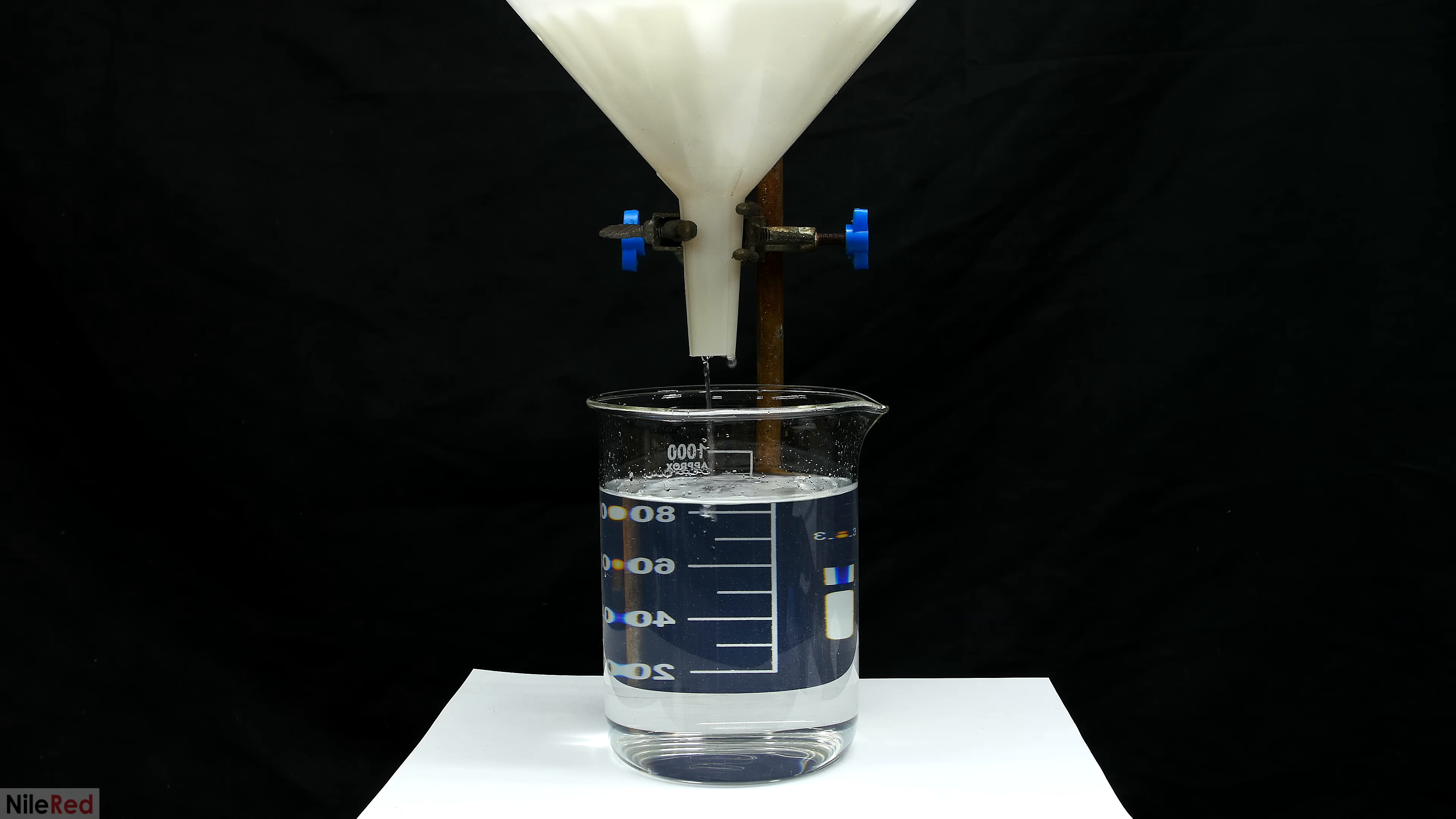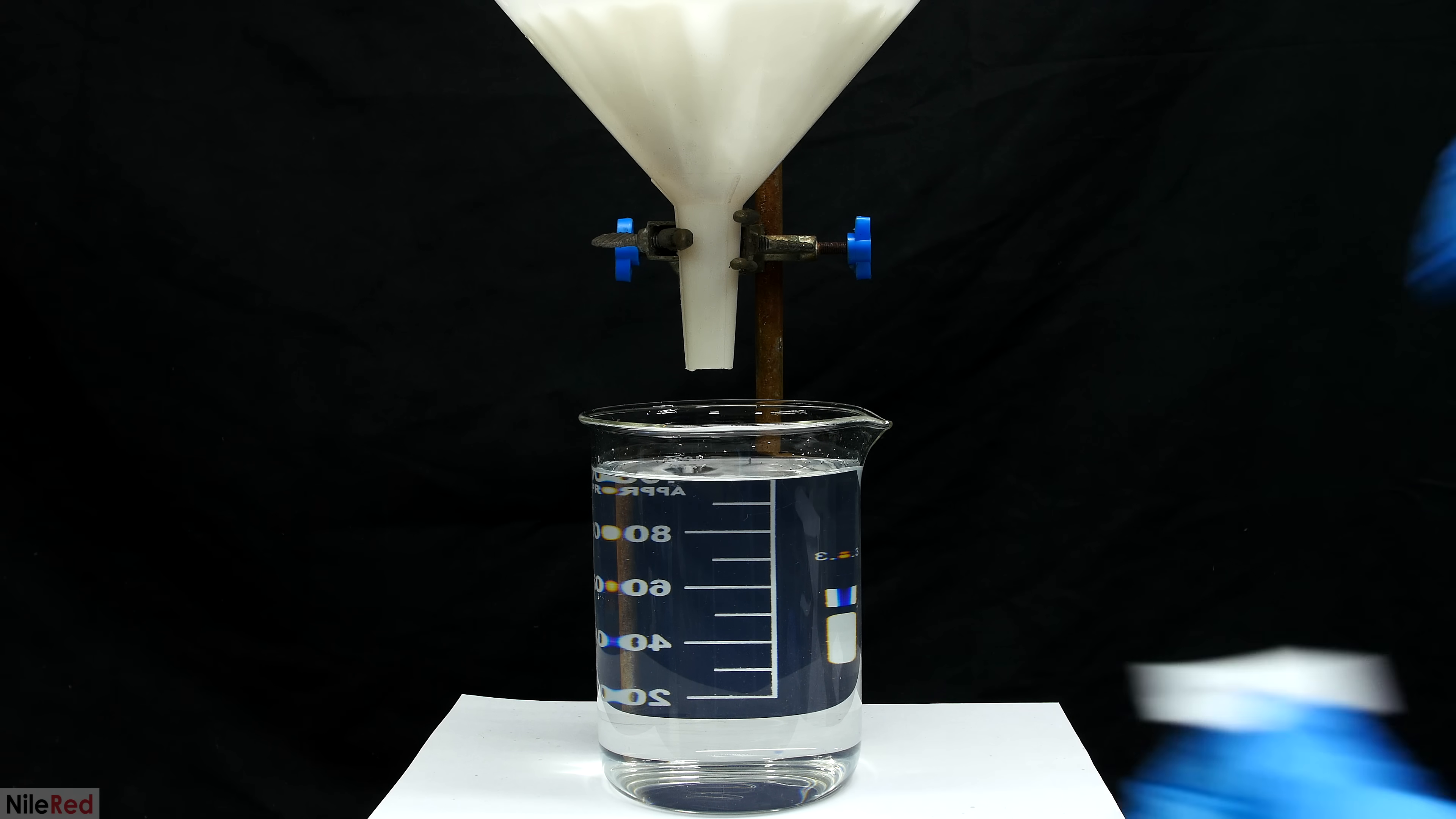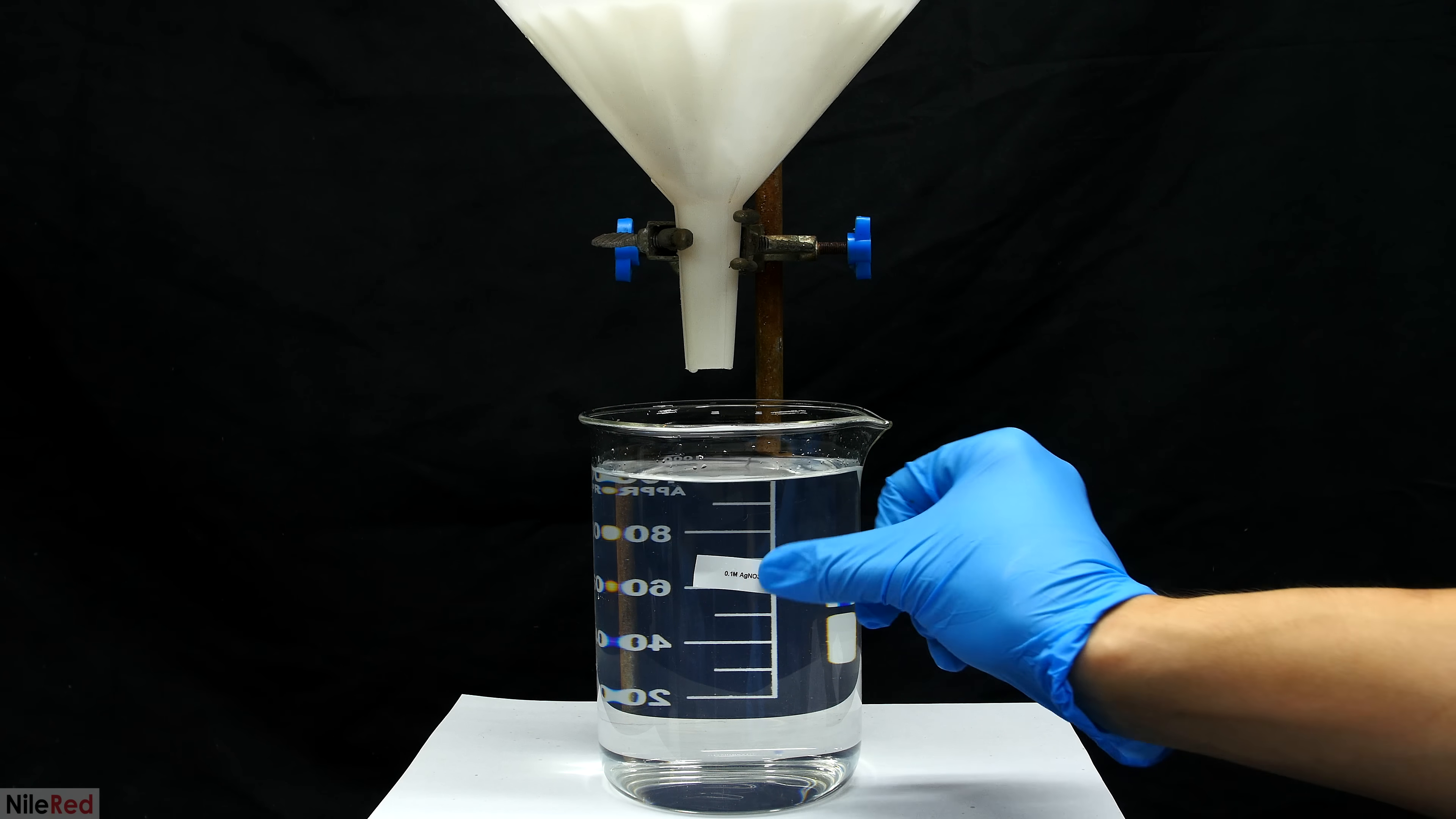After several minutes, everything eventually filters through, and I go ahead and slap on a sticker that says silver nitrate.